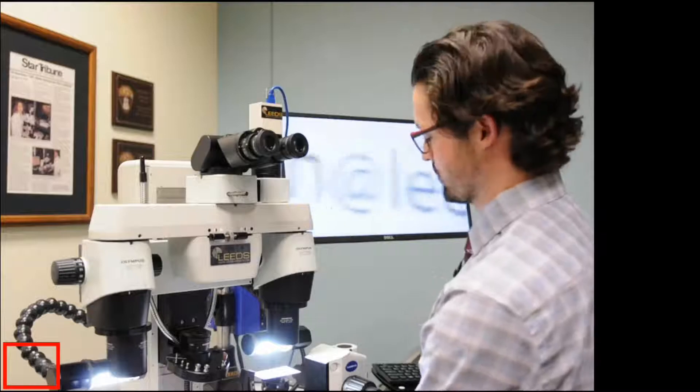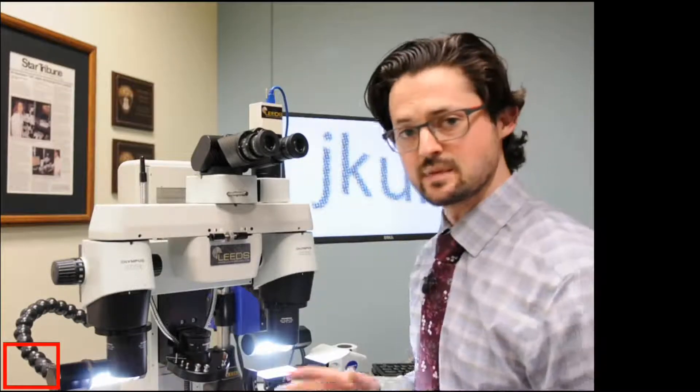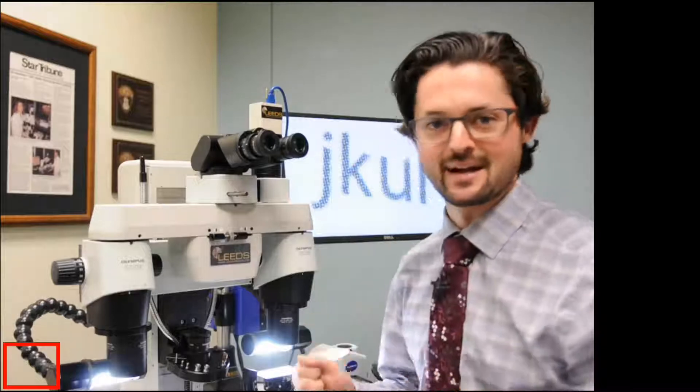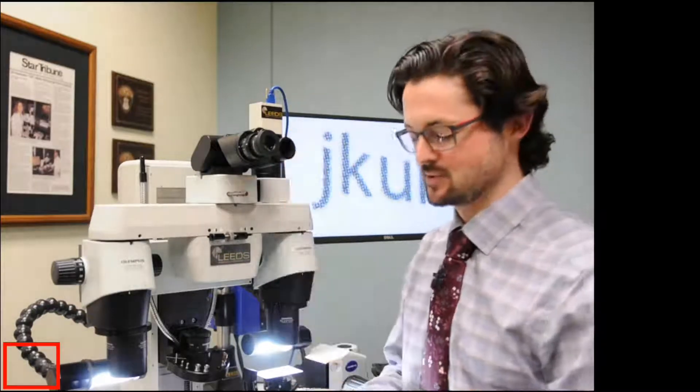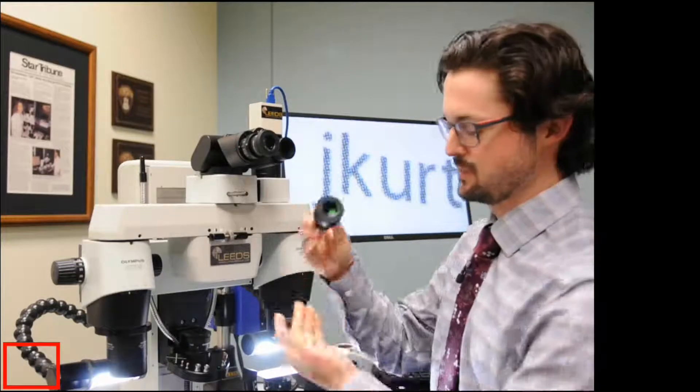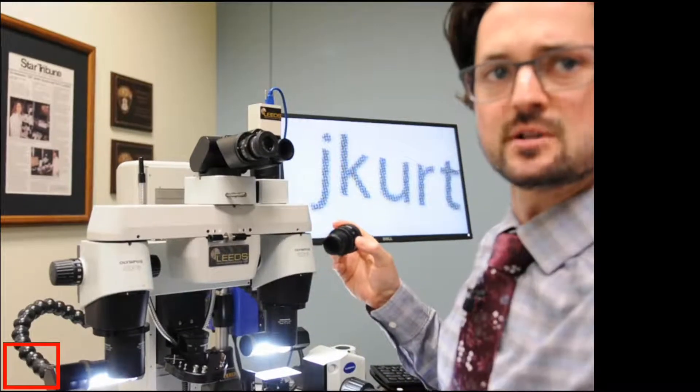And I'm going to switch entirely to one side of the microscope. My next step is I'm just going to orient it a little bit, put it by my name. My next step is to screw up my eyepieces, make them totally wrong. And the way you do this is you can, on this type of binocular head, you can pull the eyepieces out on one side. And what I'm going to do is I'm just going to zoom in a little bit.